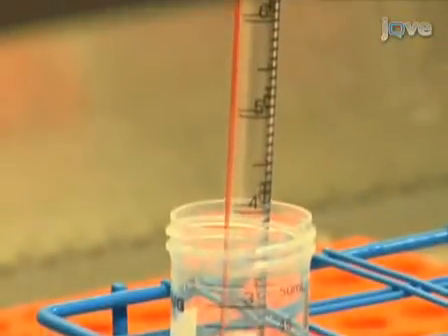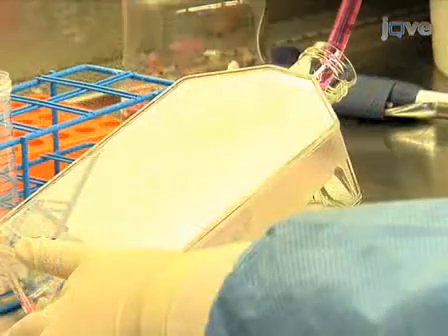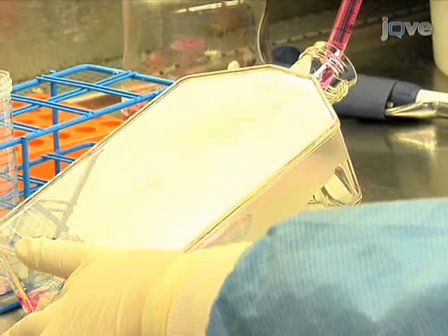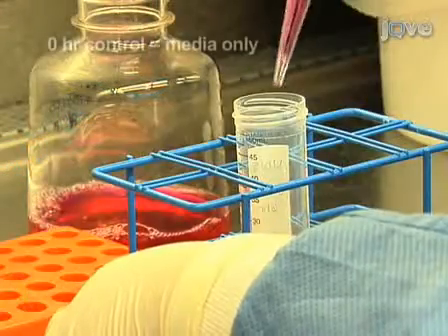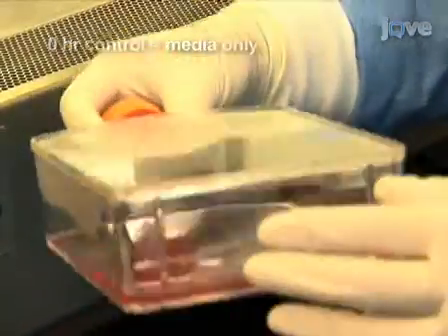Remove the media from the cells and rinse with room temperature PBS. Add the virus or viral growth media to each flask. For a 0-hour mock time point, add the viral growth media only with no virus added. Swirl gently and tilt the plates.